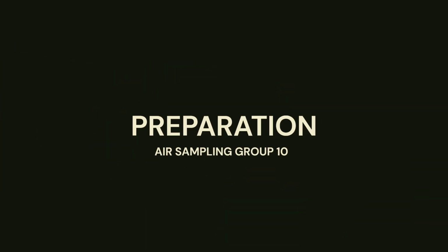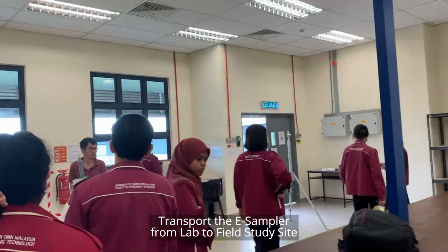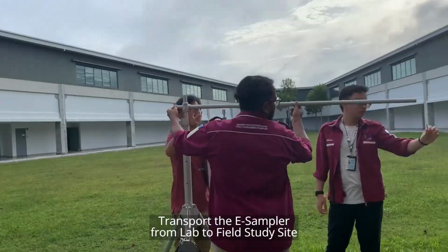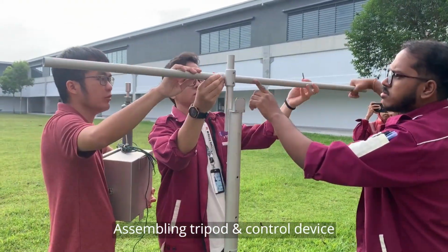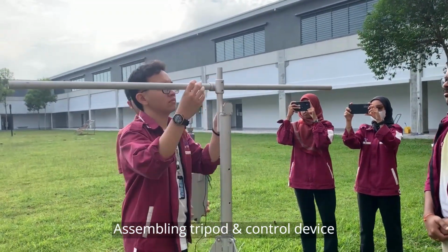We will present how to prepare the e-sampler and the procedure of the air sampling. Firstly, we transport the e-sampler from the lab to the field study site. Then we assemble the tripod and attach the control device on the pole. We make sure to screw the pole together carefully.